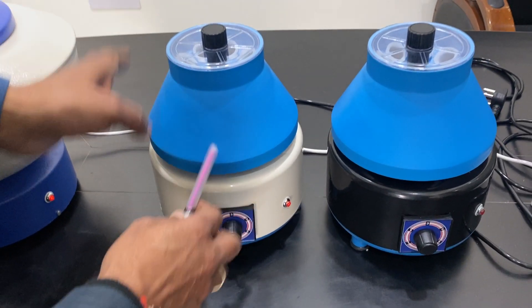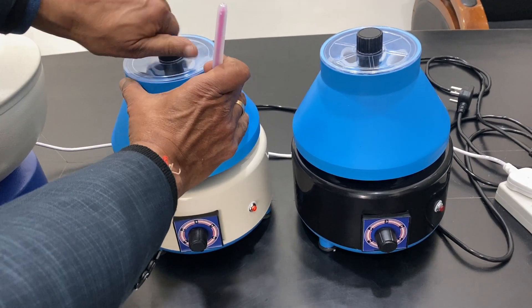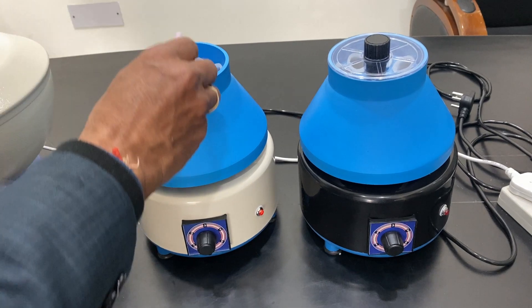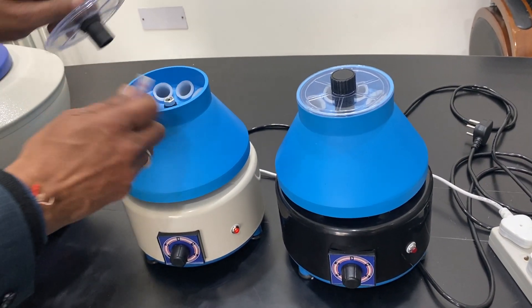Generally, a required rubber gasket is there so that there is no sound. This is called the Medico model — it is dome-shape, a doctor model, where we have the opening from the top. The tubes are placed here based on the tube capacity.